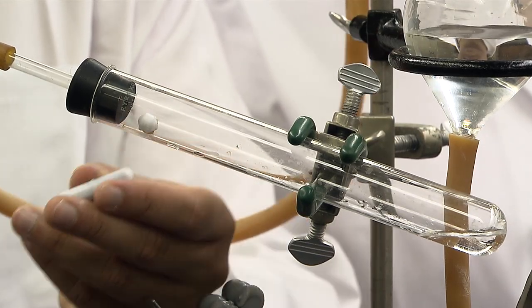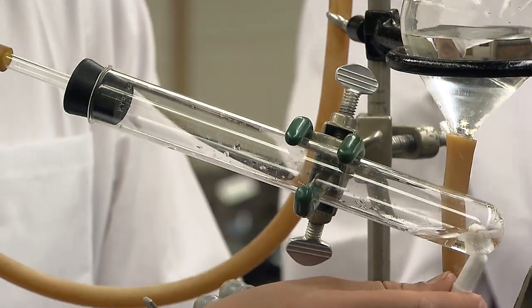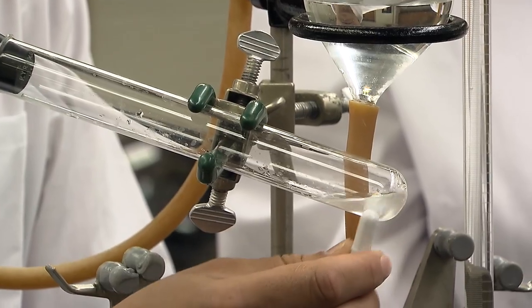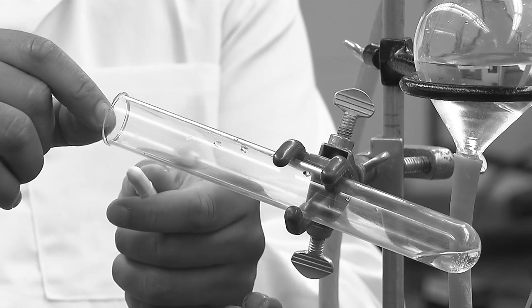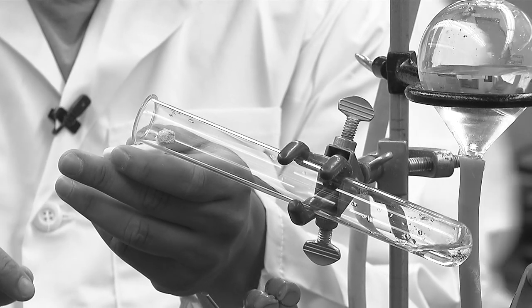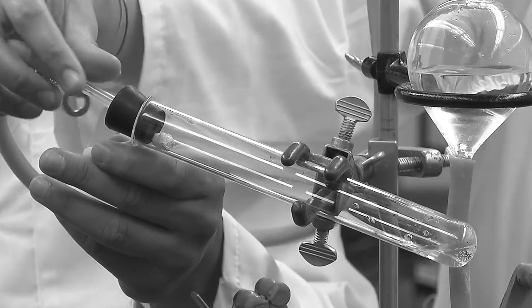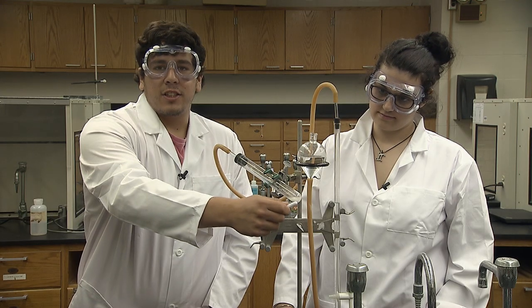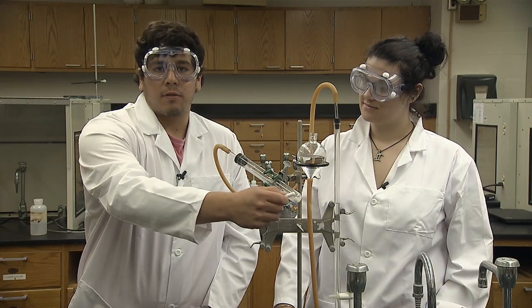Watch the How to Use Graduated Glassware video if you need help reading the burette. When everything is set, release the large magnet and use it to stir. If the magnet drops before everything is set, clean up the test tube and magnet and reset. Jenny has to adjust the bulb for every 10 milliliters the water level in the burette goes down.